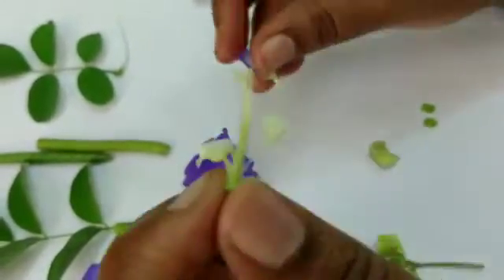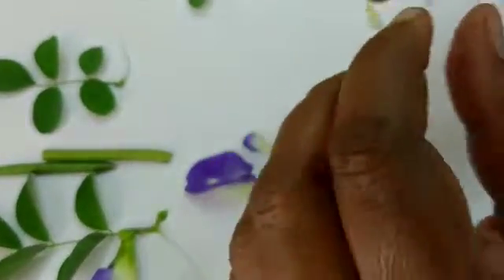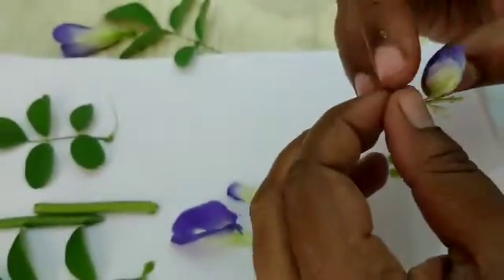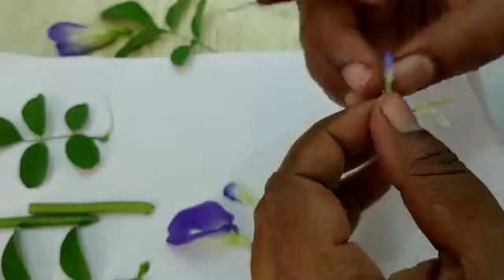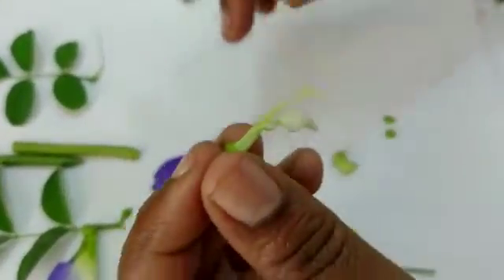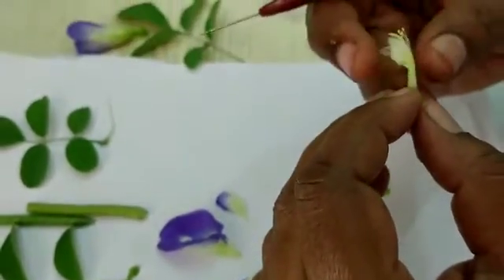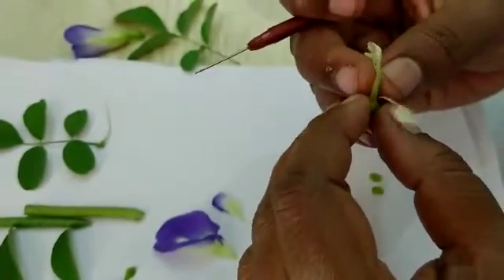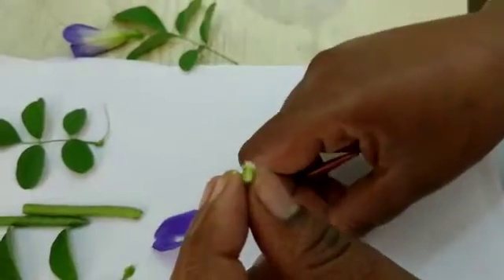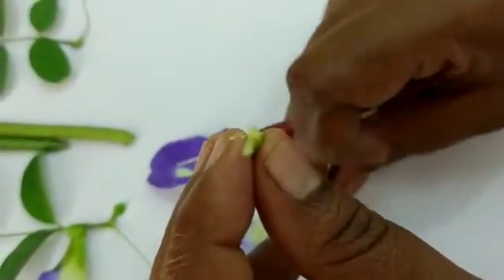Let me remove the wing petal — it is purple in color. I am removing it; they are coming out nicely. The wing petal and the keel petal are united at the base. So five petals are present in total.